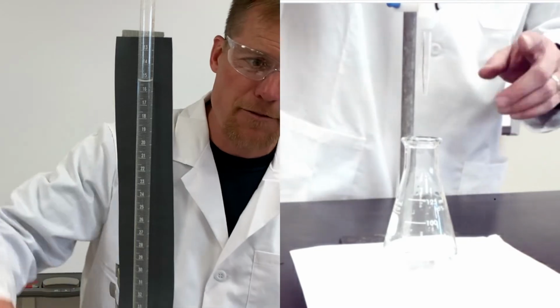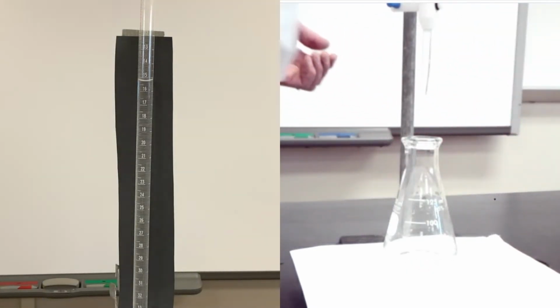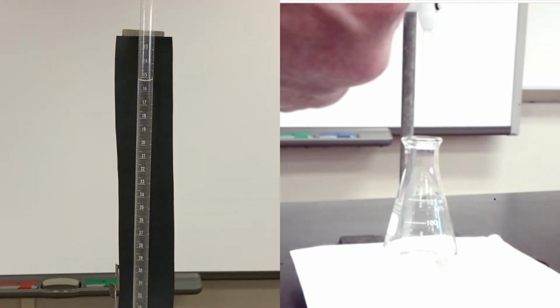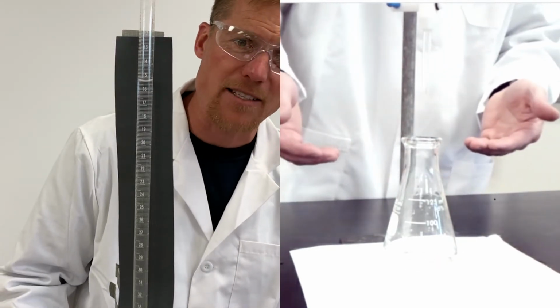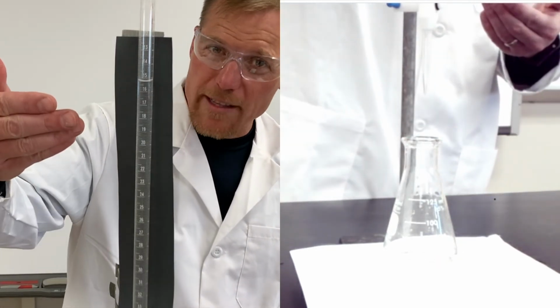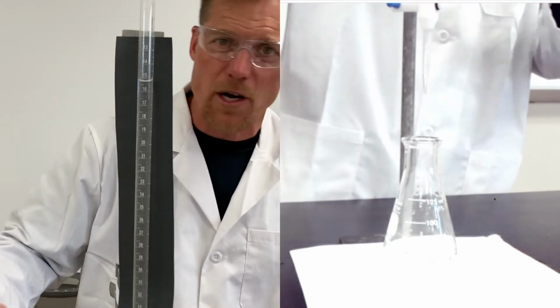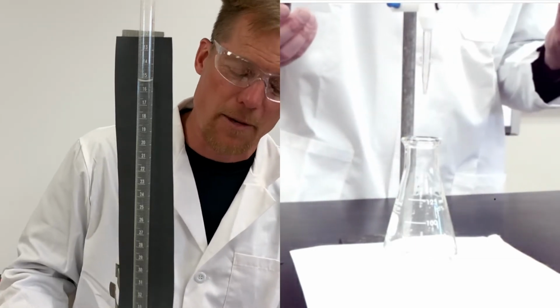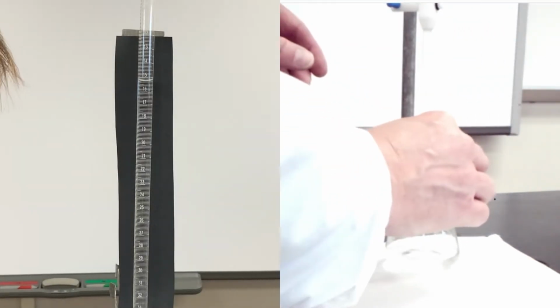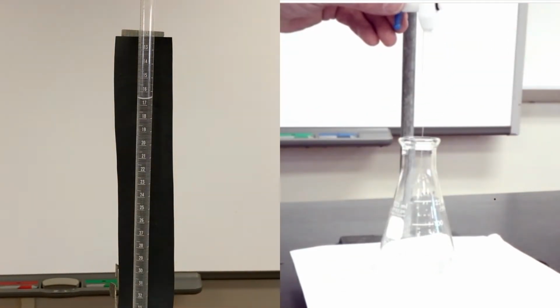Now remember, I didn't have to fill the burette back up to 0. I know my initial volume right now. It's at 15.3. I wanna add about 15 more milliliters into my flask. And so I've recorded that I'm at 15.3, and I'm gonna shoot for about 30.3. If I overshoot or undershoot, no big deal. I just write down whatever it is I end up at, okay? So let's add our acid to our flask. Opening up the stopcock, letting the acid flow in there.